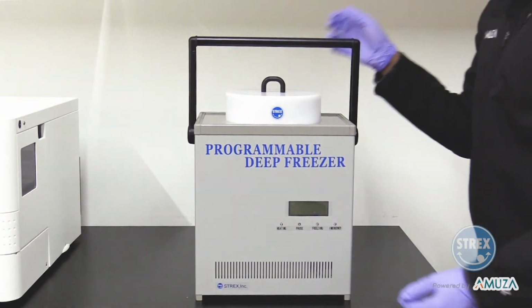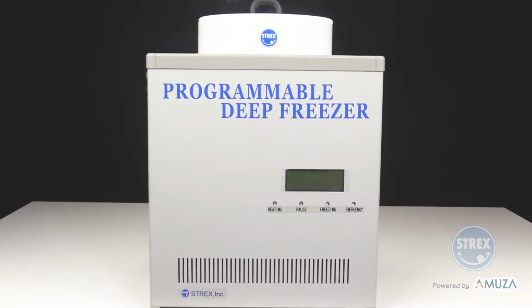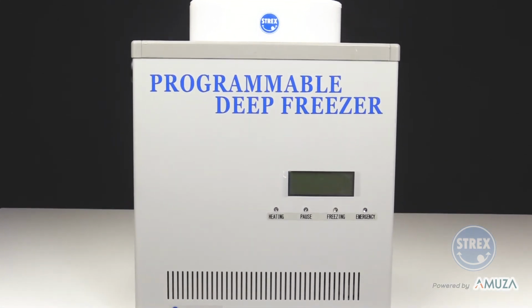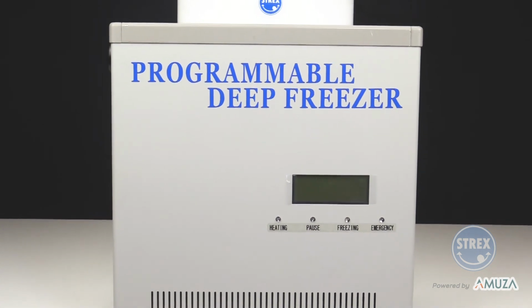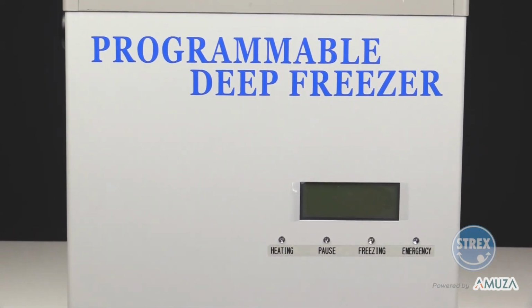Overall, the Cryocell is a liquid nitrogen-free controlled rate freezer, reducing the risk of contamination and allows for an easy, hazard-free freezing process. Available in 2 sizes, the Cryocell can accommodate a multitude of cryovials, tubes, and bags.